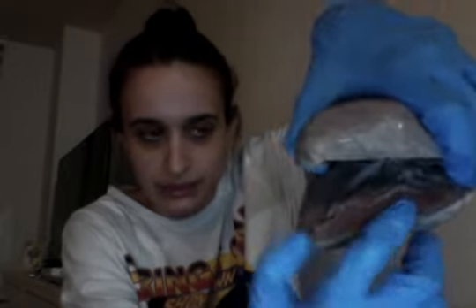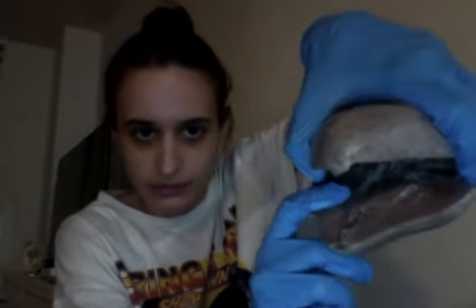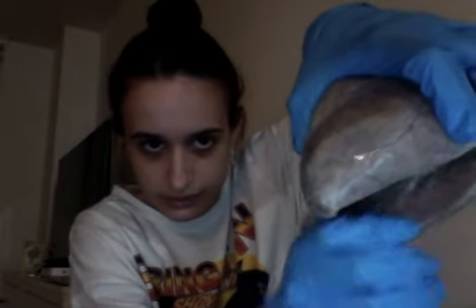From there we have the interventricular sulcus, which separates the left and right side. So that's all over here, and that's what would separate the left from the right. Then we have the endocardium, which covers the inner surface of the heart. So again, all over here, endocardium.